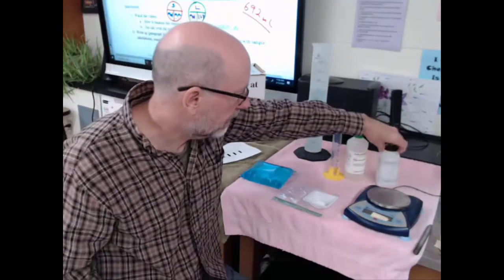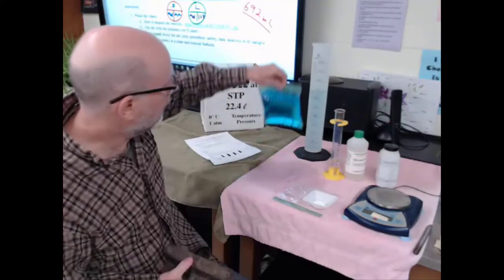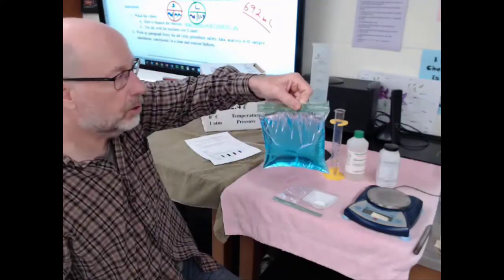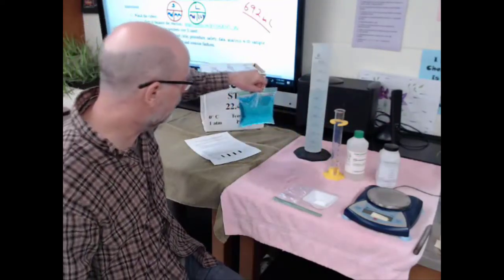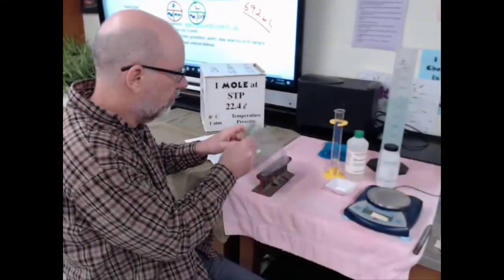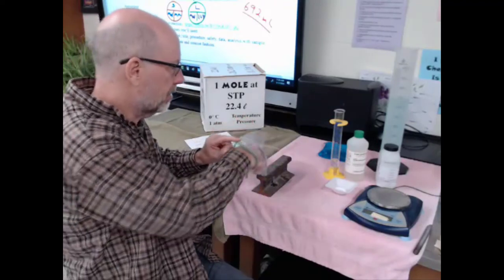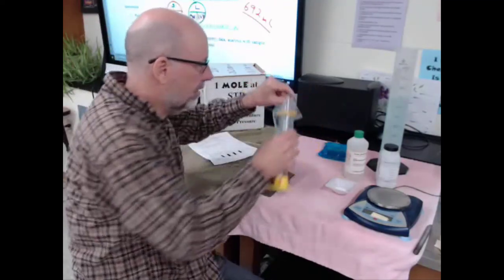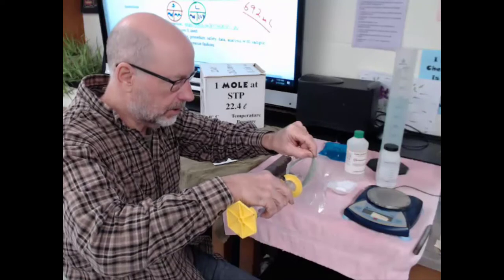There's my bag - it holds 692 milliliters. I wonder how many liters that is. I'm going to take my bag and put the nitric acid, which is in great excess, so I have more than what I need and don't have to worry about that for my calculations.